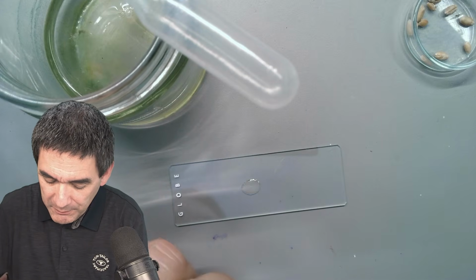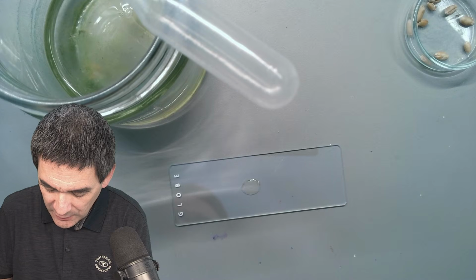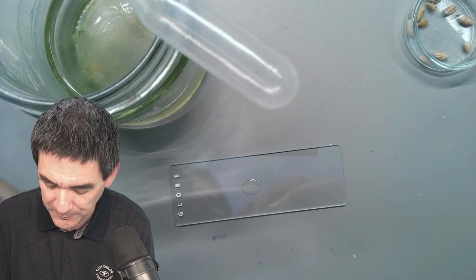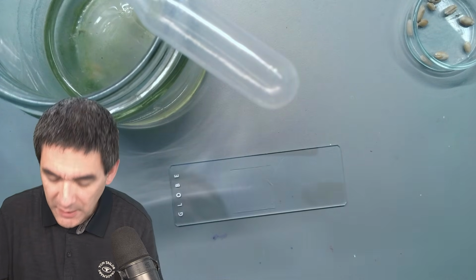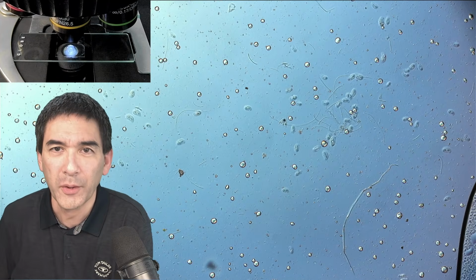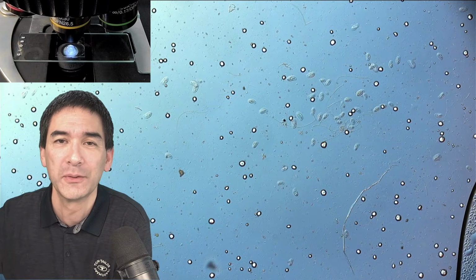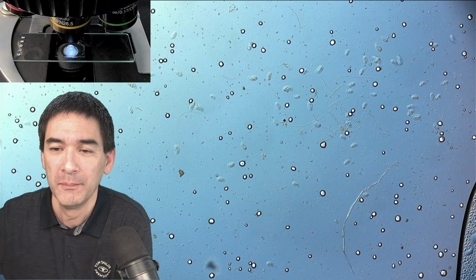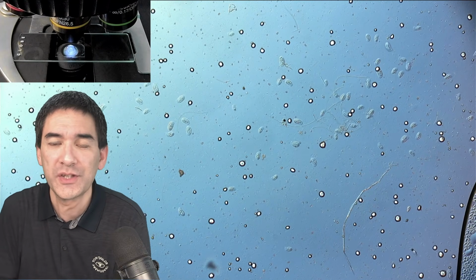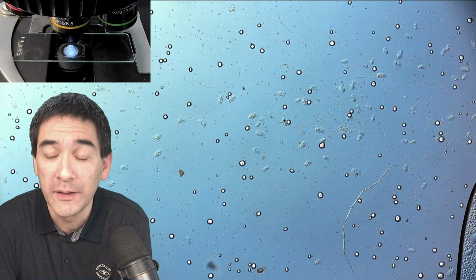But there is a slightly different way, because what I've done right now is I went all the way to the wheat grain to collect a sample. So let's have a look at this under the microscope, and let's see what we're able to find here. I'm now using my 10 times objective, and as we can see, there's plenty of life going on here. Of course, much more than what you would normally be able to see in the water sample. And look at those bright white dots. Now, these are starch grains from the wheat, right?